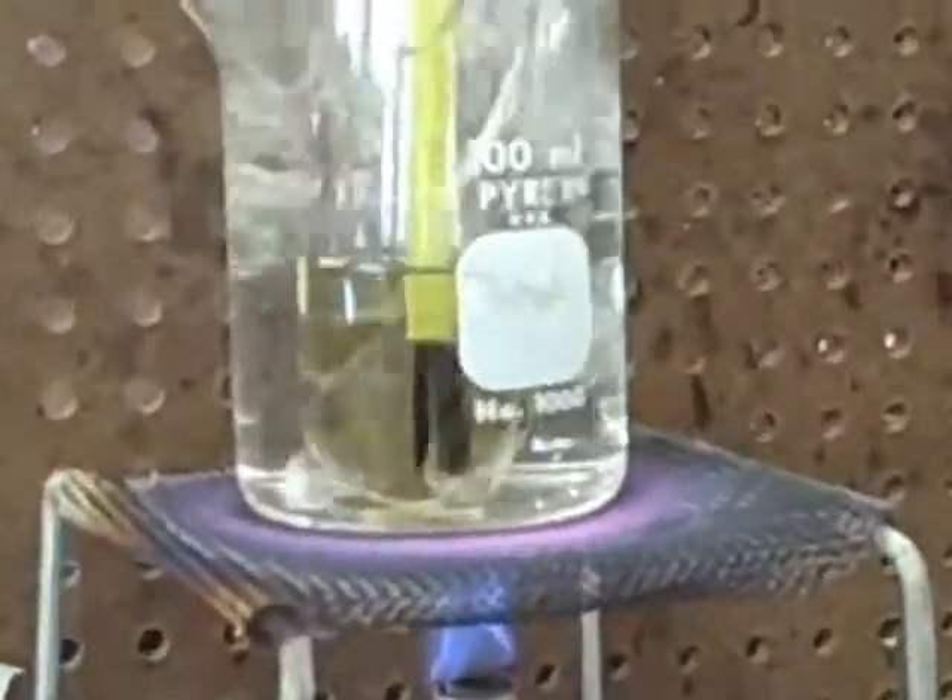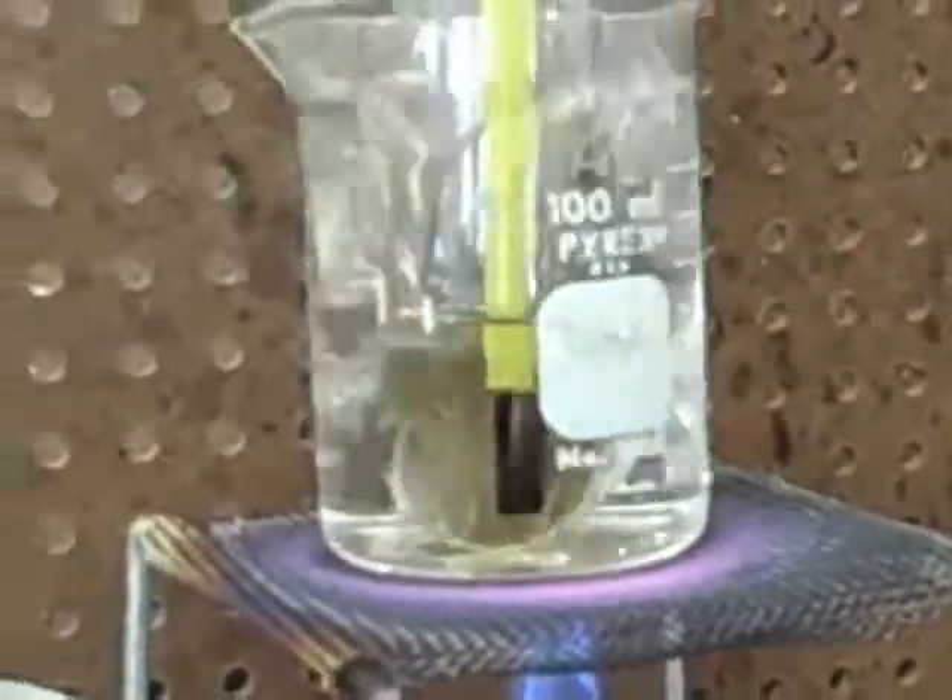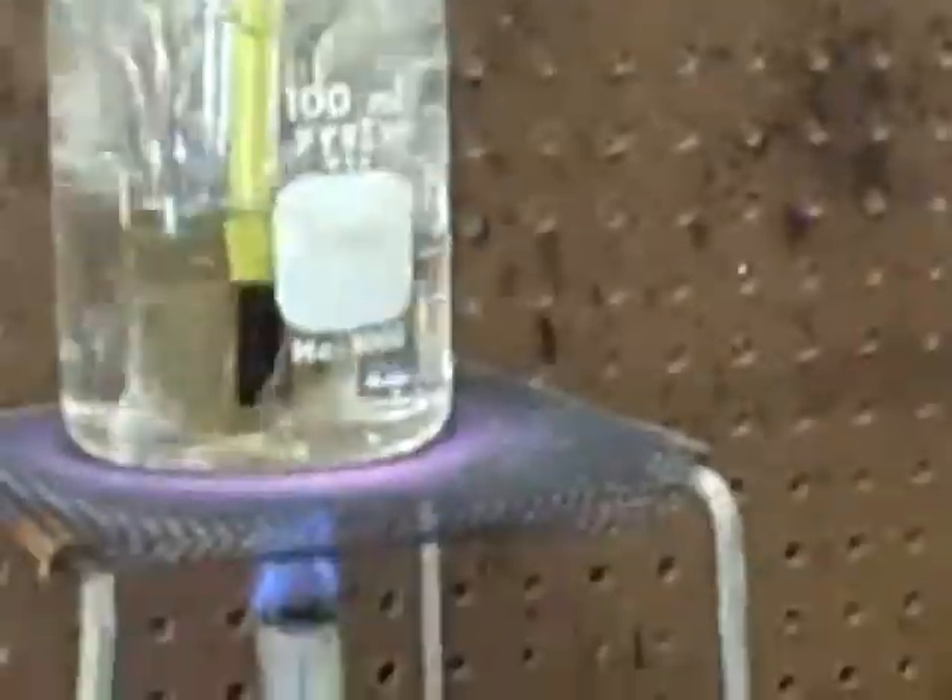It's almost melted — now it looks like tea. Are you sure that's in focus? Because you're very close. I think it's completely melted, Jason. It looks completely melted. You tell me, folks — for you watching out there, this is Dora. Has the substance completely melted?